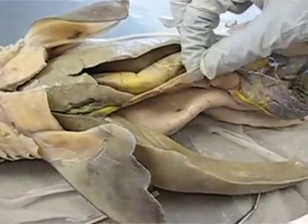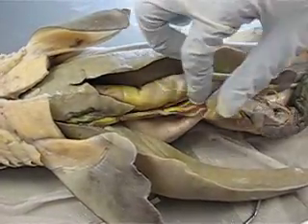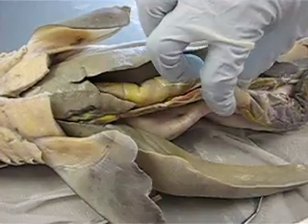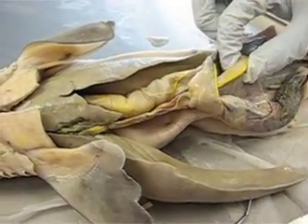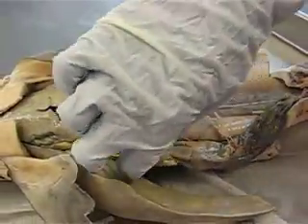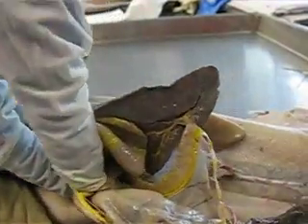Here's the common bile duct. It's going to be kind of a paler color, and it's going to go to the ventral lobe of the pancreas, which is right here. Here's the dorsal lobe of the pancreas, and they're going to be connected by the isthmus, which is right in here.